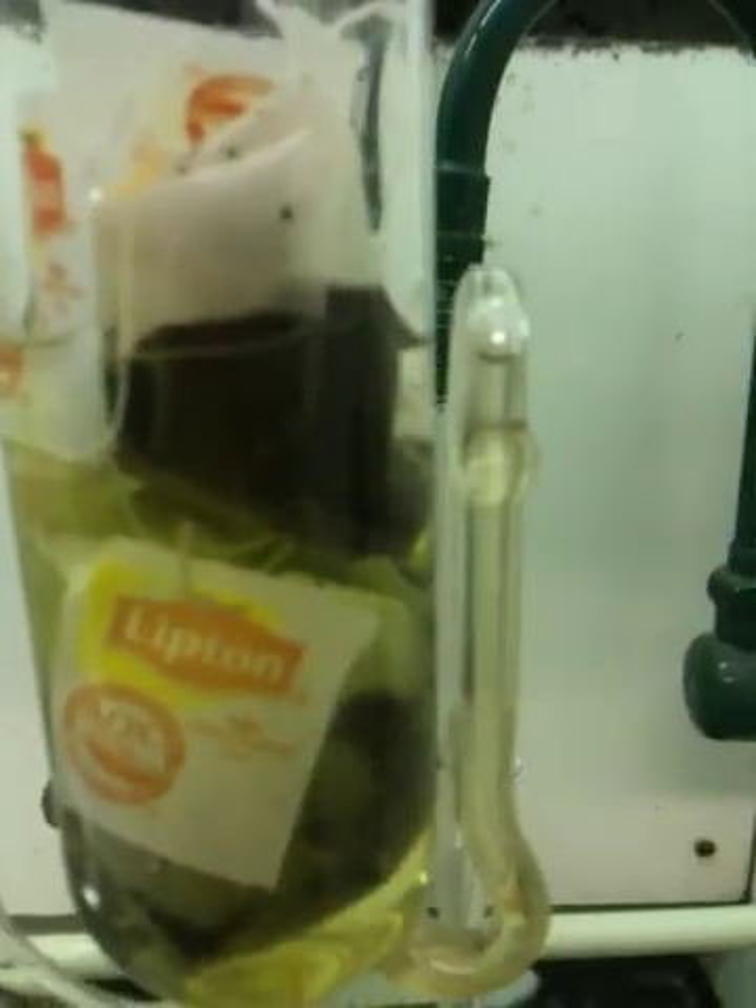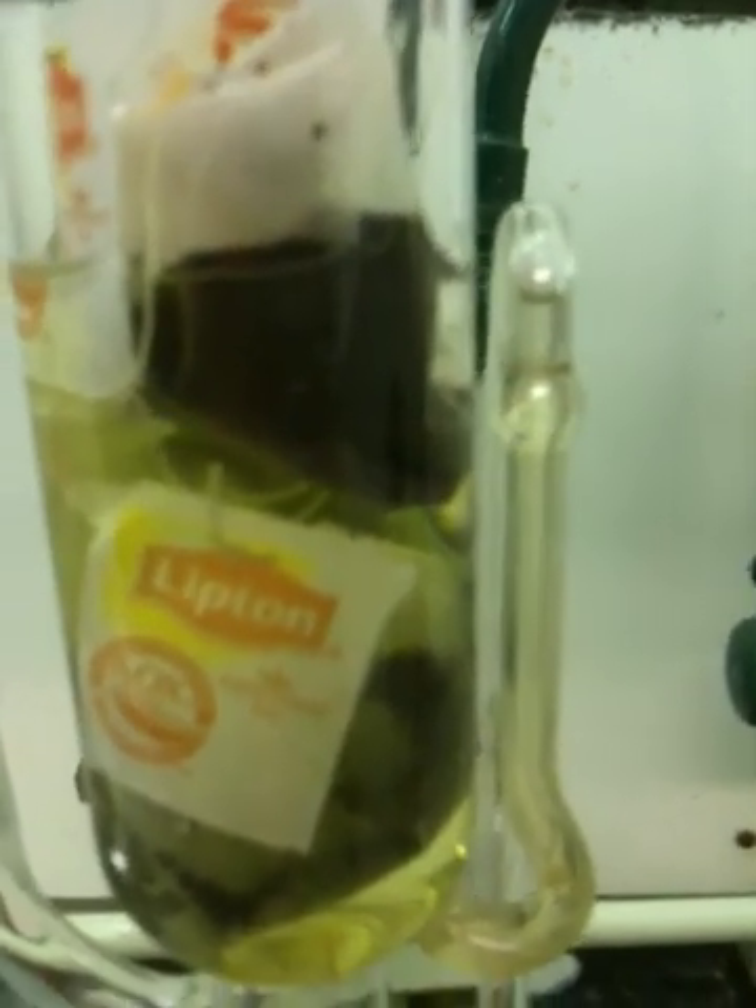And as it's filling, you can see it's turning green, extracting caffeine out of the bags and some chlorophyll, obviously, and a few other molecules.